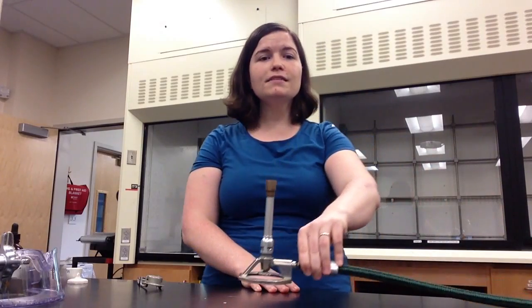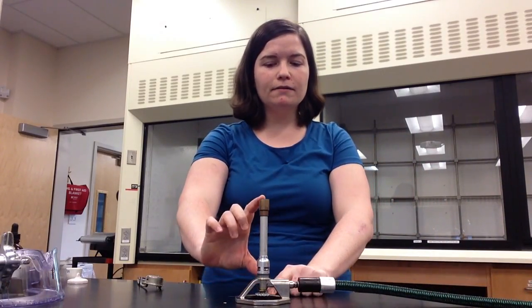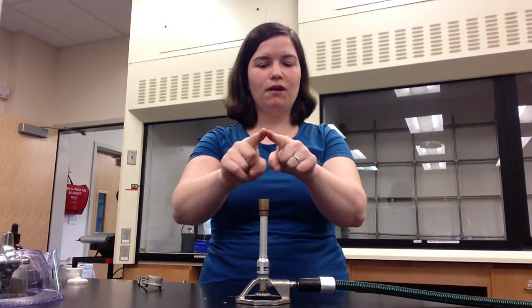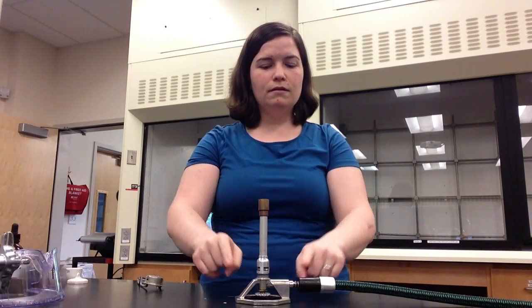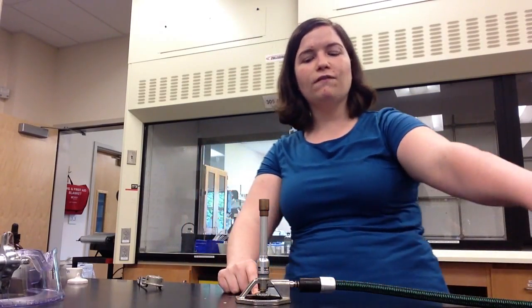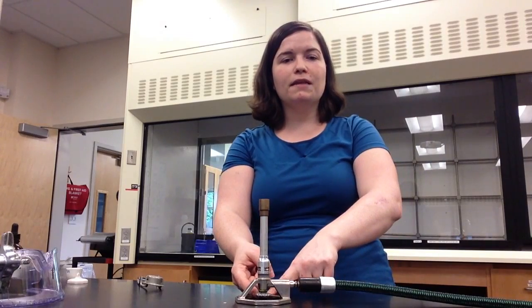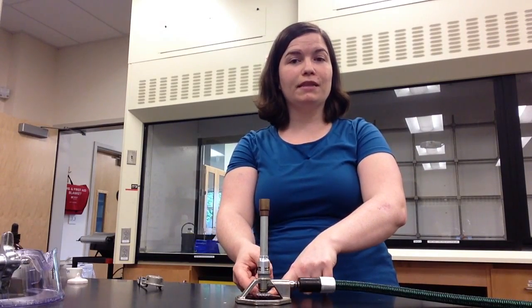I'm first going to show you how to use a Bunsen burner. This is a Bunsen burner. It has a long barrel, and at the top of it, the Bunsen burner flame will come out. There's also a hose which connects to a gas valve and handle, and a knob at the bottom that allows me to control how much gas is entering the Bunsen burner.